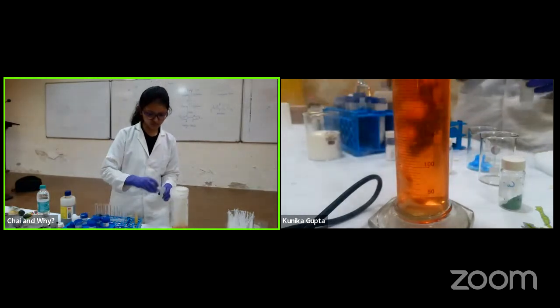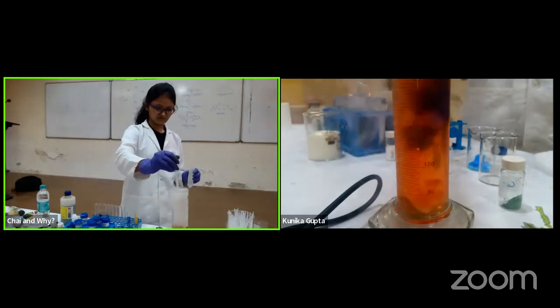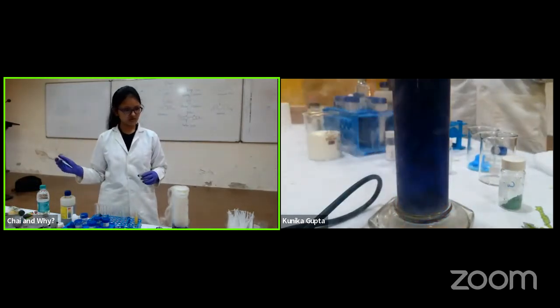Sure, I can do it for you. Just add something and let's see if we can do this color change one more time. There we go. Blue. So it has gone blue again.